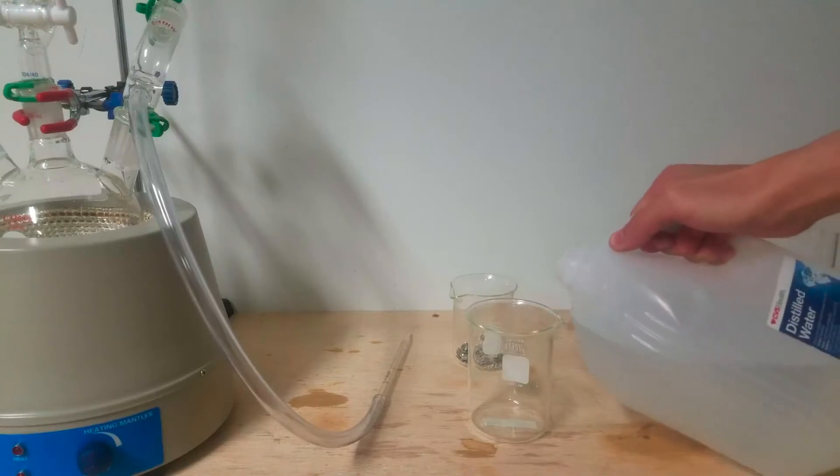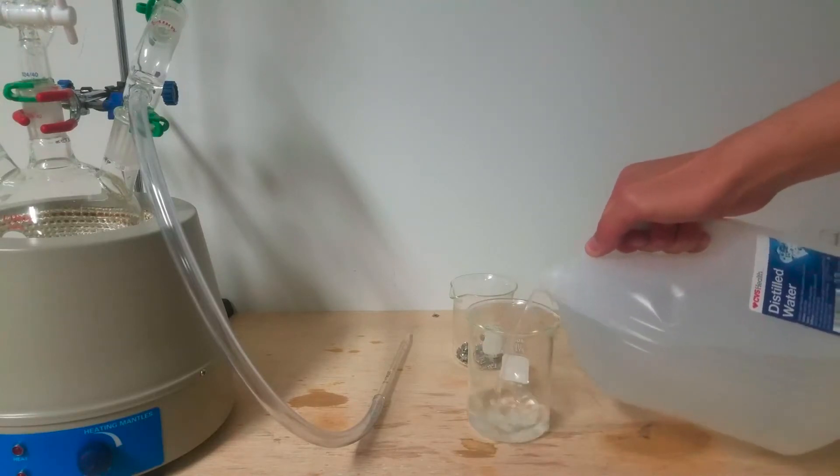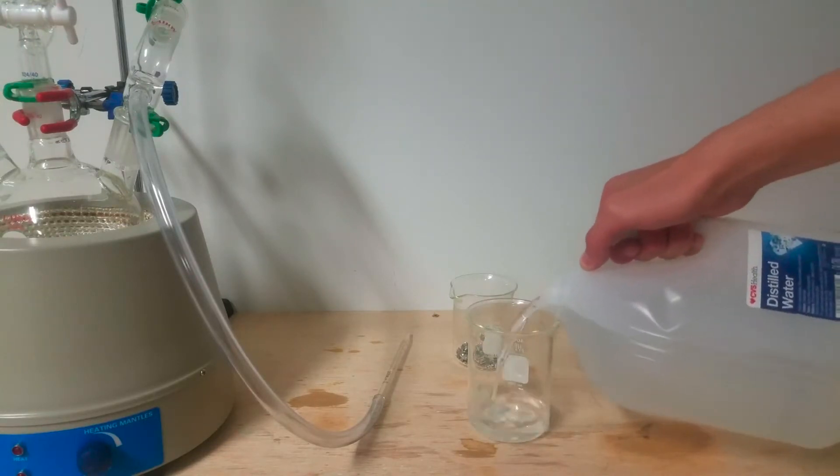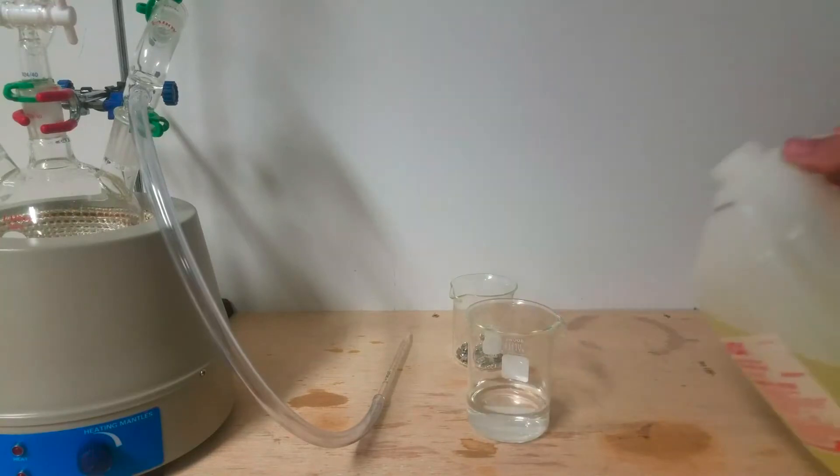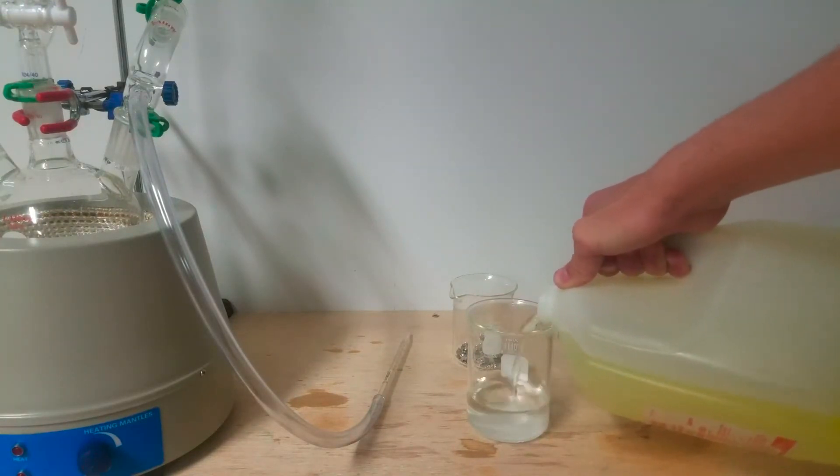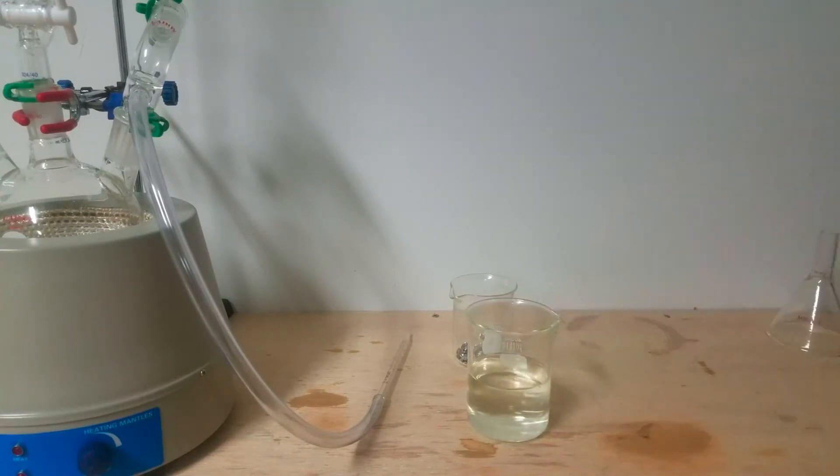After that, I decided that the 250ml beaker was way too small, and I started prepping a 400ml beaker with a random amount of distilled water and a random amount of hydrochloric acid. The acid I used was tainted slightly yellow from iron from the manufacturing process. The solution I was using was about 0.1 molar, so the bismuth was absolutely in excess, and the entire reaction was going to be painfully slow.